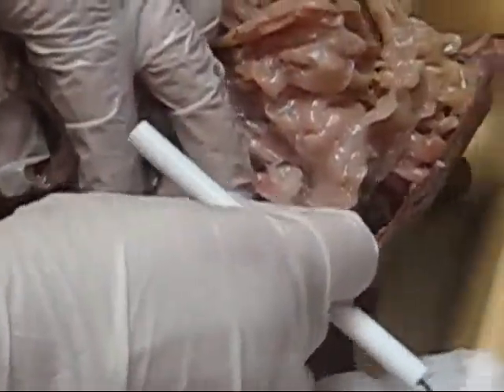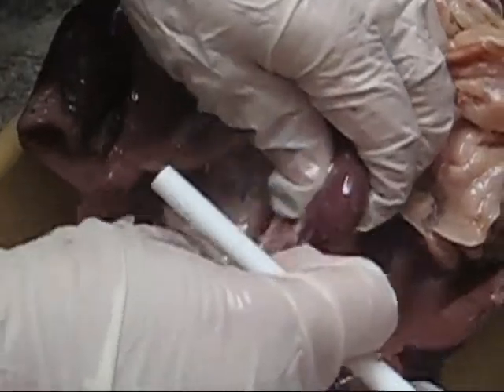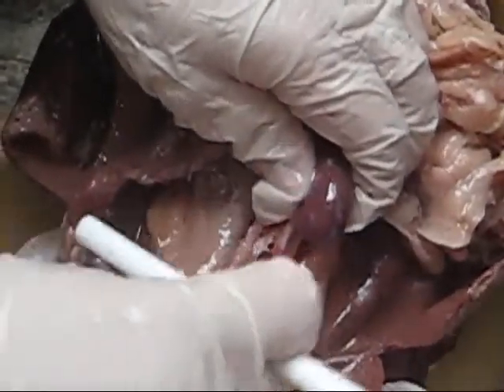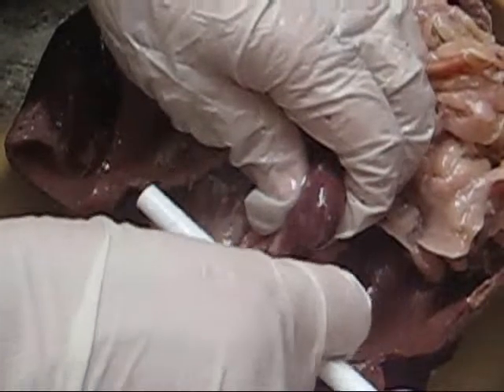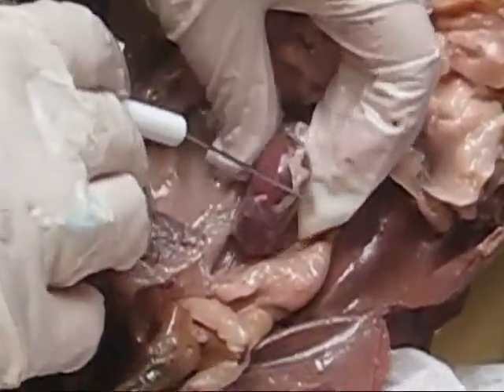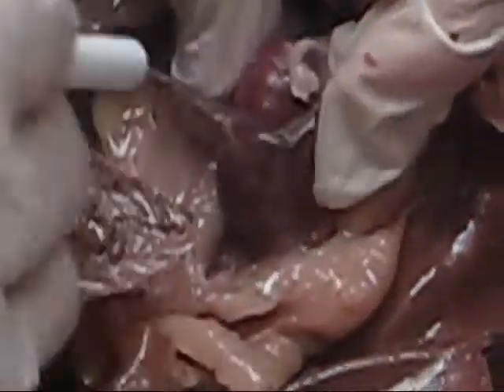We're going to pop the kidney out. Be careful with your cameras, please. A lot of fat — we spoiled him. Do you see the capsule right there? The renal capsule.